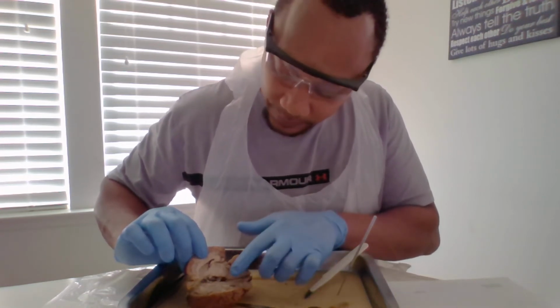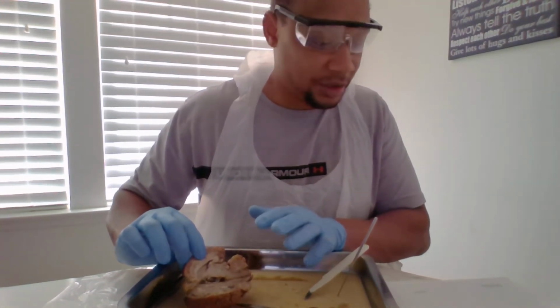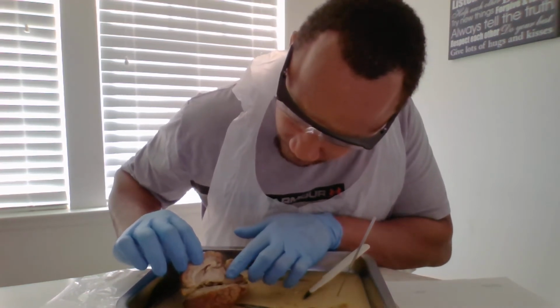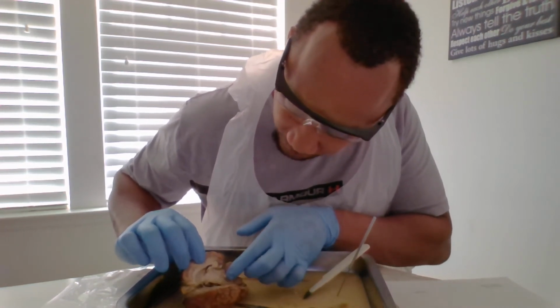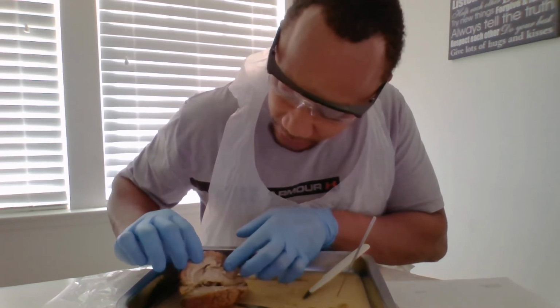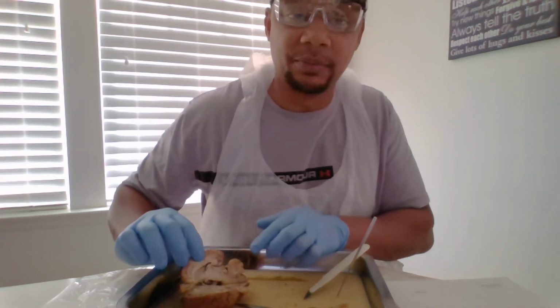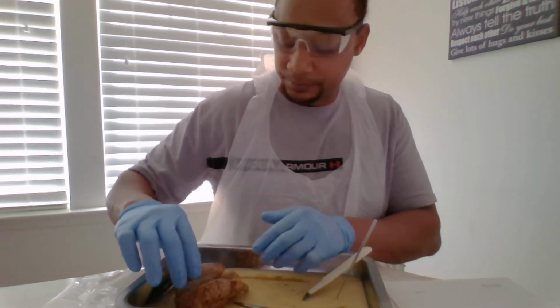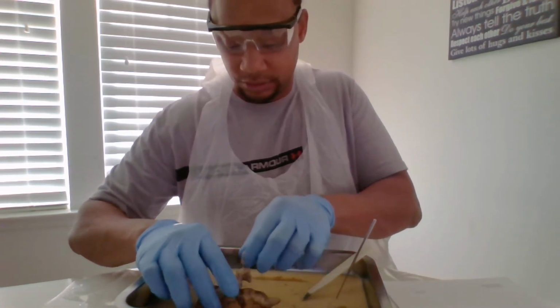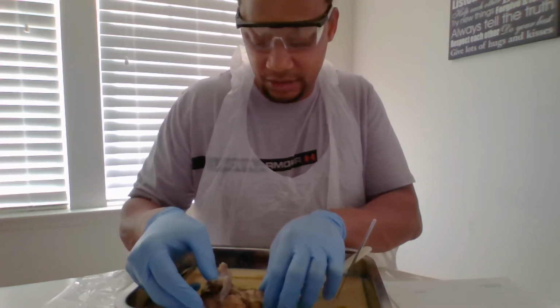It's somewhat right above the superior and the inferior colliculus, which are these two right here. You have that flap right there. Above you have the superior, and below you have the inferior. I will have to turn it over for your pons, because that's the best way of seeing it.